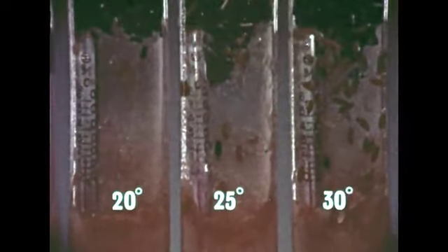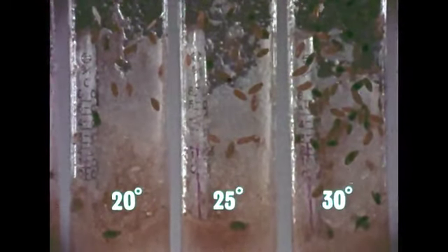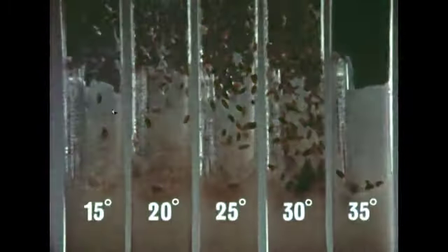As the days pass, we can see that the flies are multiplying. Now we see how much temperature influences the reproductive rate. Is the best temperature for reproduction within the range of temperatures we found best for general life activities?